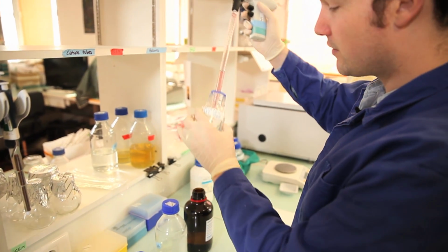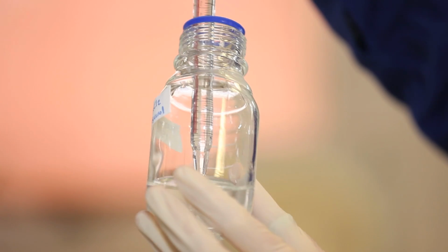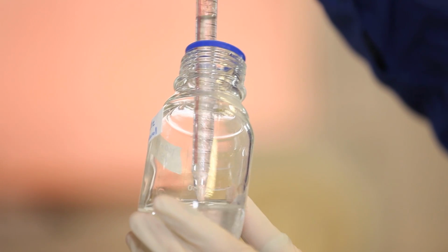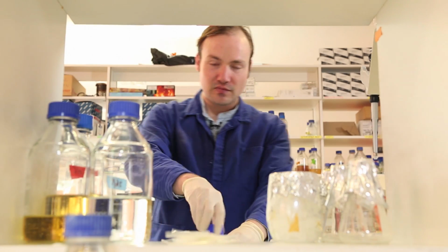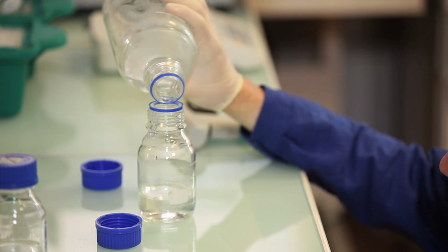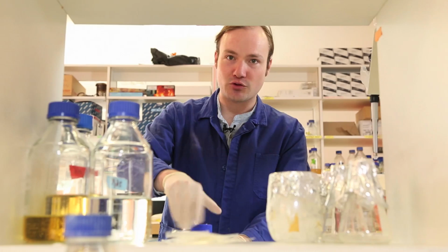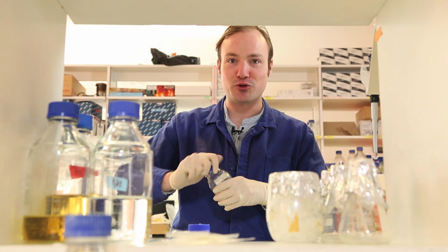And now this is why I added some water to the solution: when I add the glycerol, I want to pipette up and down just to wash the excess glycerol from the pipette tip. Okay, cool. And now we'll take the water and top off the solution, bringing the total volume up to 100 mils. You can tell I'm not being too careful with my measurements for these solutions, and that's okay. I don't need to be. They're quite forgiving, and close is good enough.